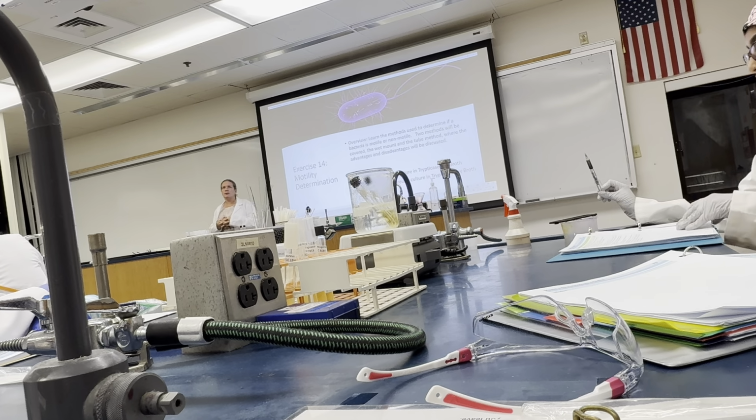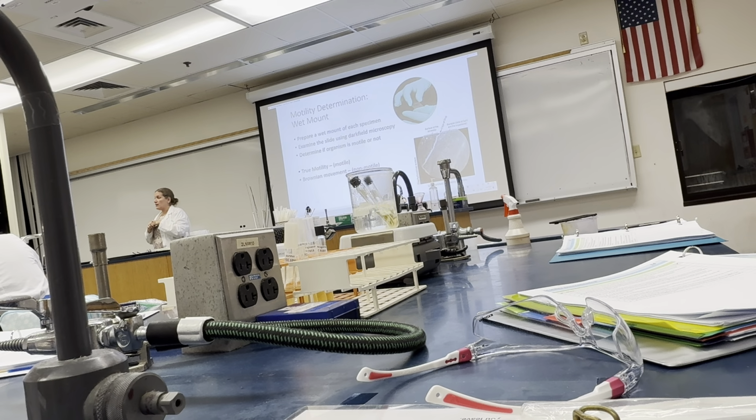All right. So, for the wet mount procedure, again, as a table you'll do 2 slides, one for each organism. You're going to prepare the wet mount just like we did at the beginning of the term. You'll notice that at your table there is a transfer pipette. You'll use it to transfer onto a clean slide, and the cover slips are up here. Use 2 or 3 drops max. You don't want too many drops or it'll just run right off the slide, okay?